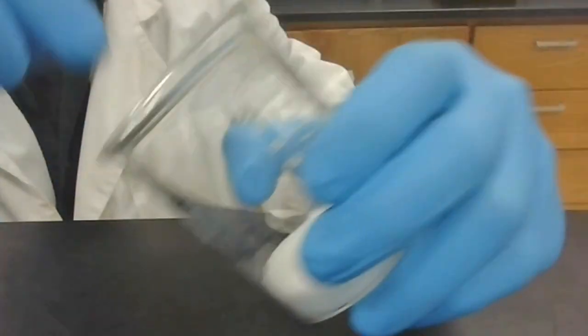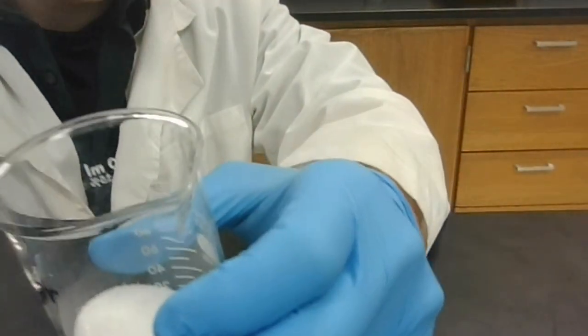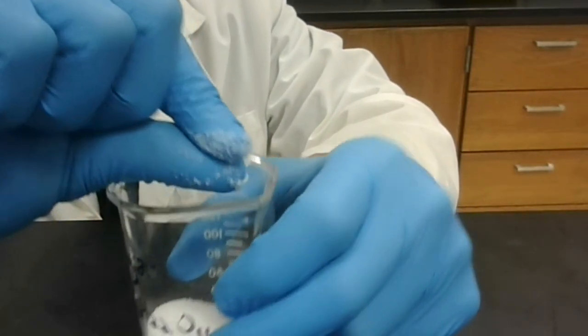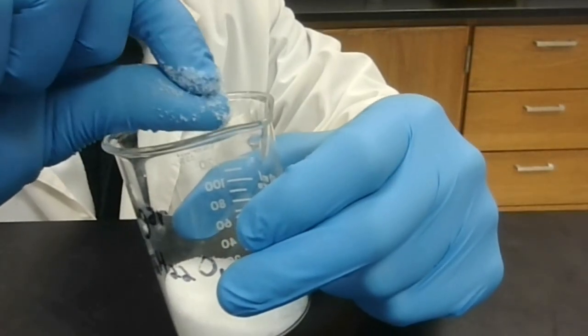I will also take a small sample of this sugar and rub it between my fingers. I can see some of its coating based on the Crisco that's still there, but what isn't coating the gloves is hard and crystalline and gritty. So the sugar I would consider as hard.